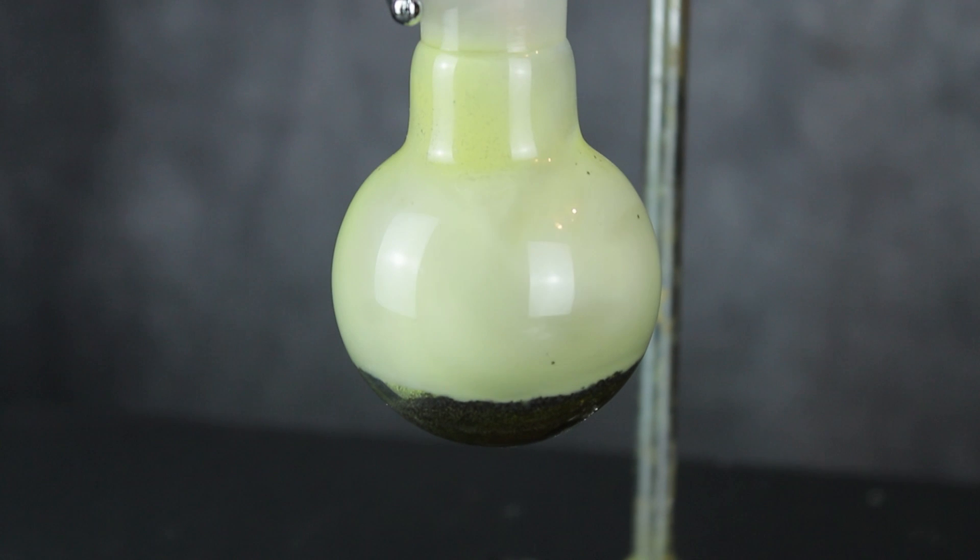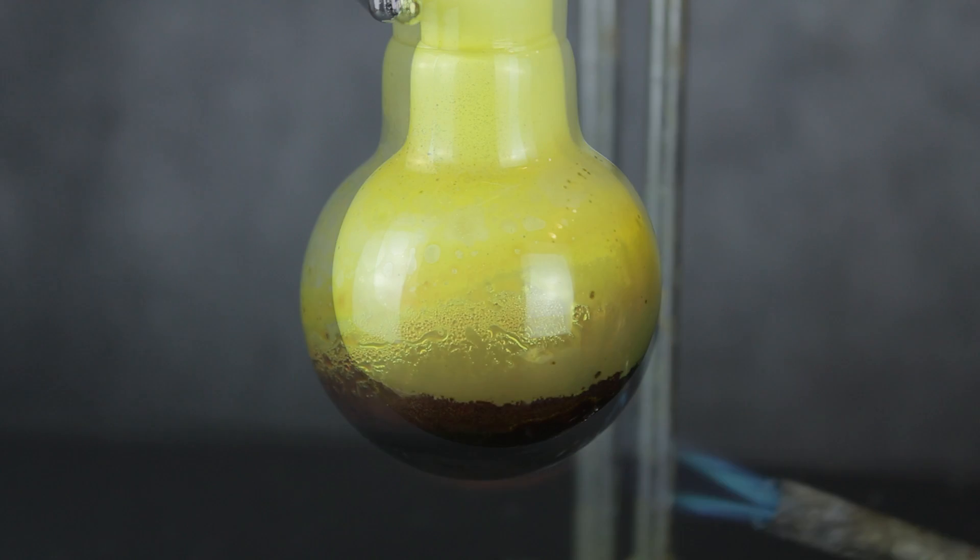However, some of the phosphorus did seem to flash boil as the reaction took off, causing a brief fireball inside the flask as all the oxygen was consumed and ejecting the glass stopper in the process. I quickly resealed the flask to prevent the product from oxidizing, and then continued heating.